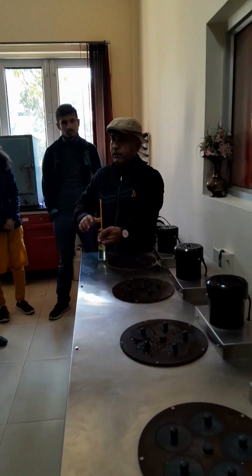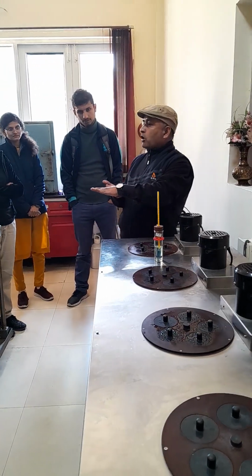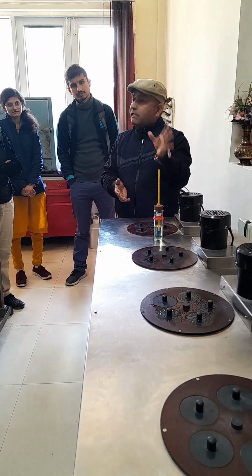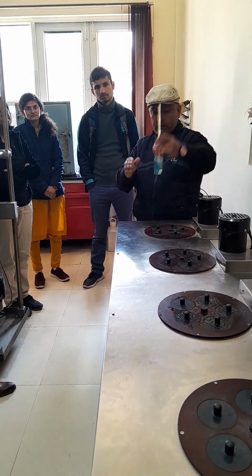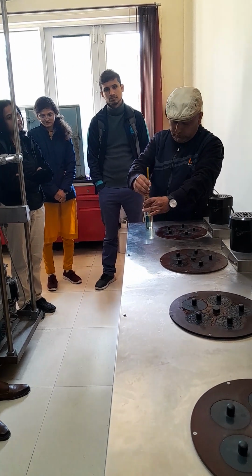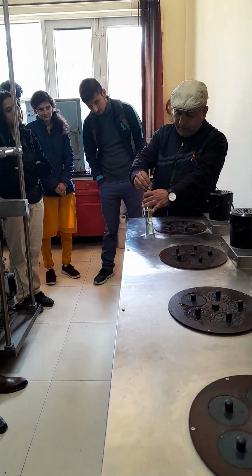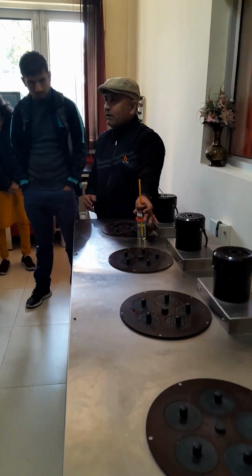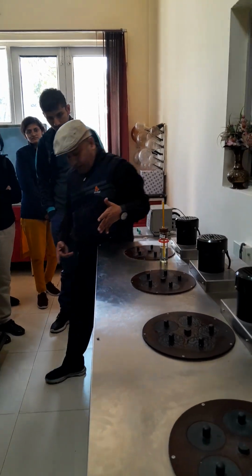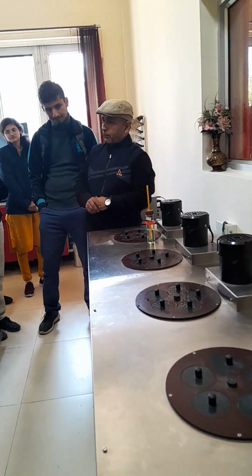What is cloud point? Lowest temperature at which you will see the cloudiness at the bottom of the surface of the tube. That tube will be standardized in condition like that. This is a pour point tube. So for cloud point you will have to keep the thermometer bulb at rest at the bottom of the tube. So you will keep it inside the cooling bath where you can see there are 1, 2, 3, 4 and 5 baths for different purposes.